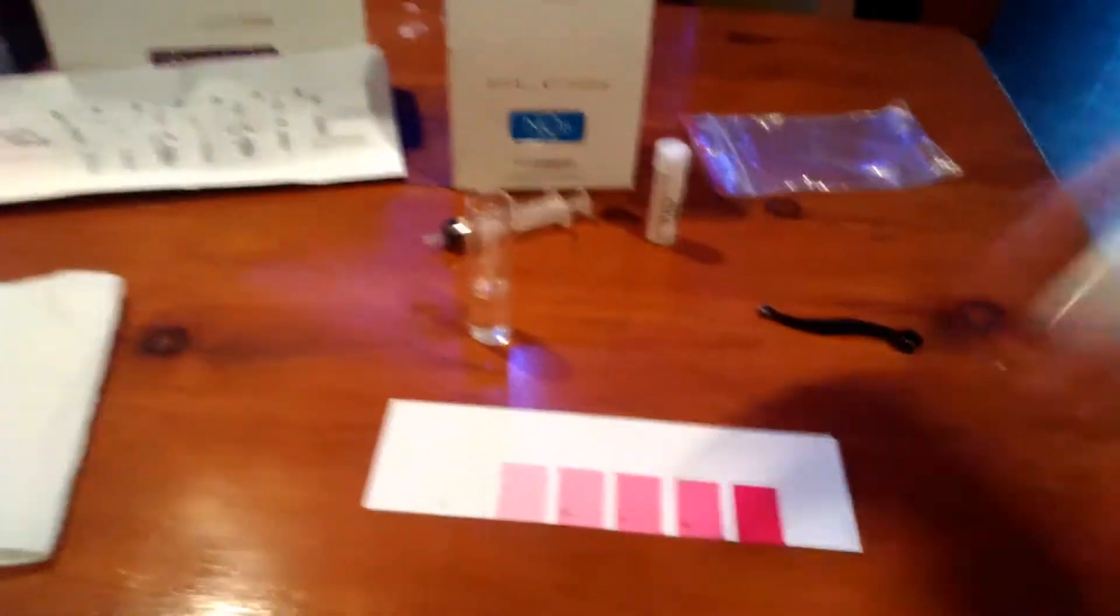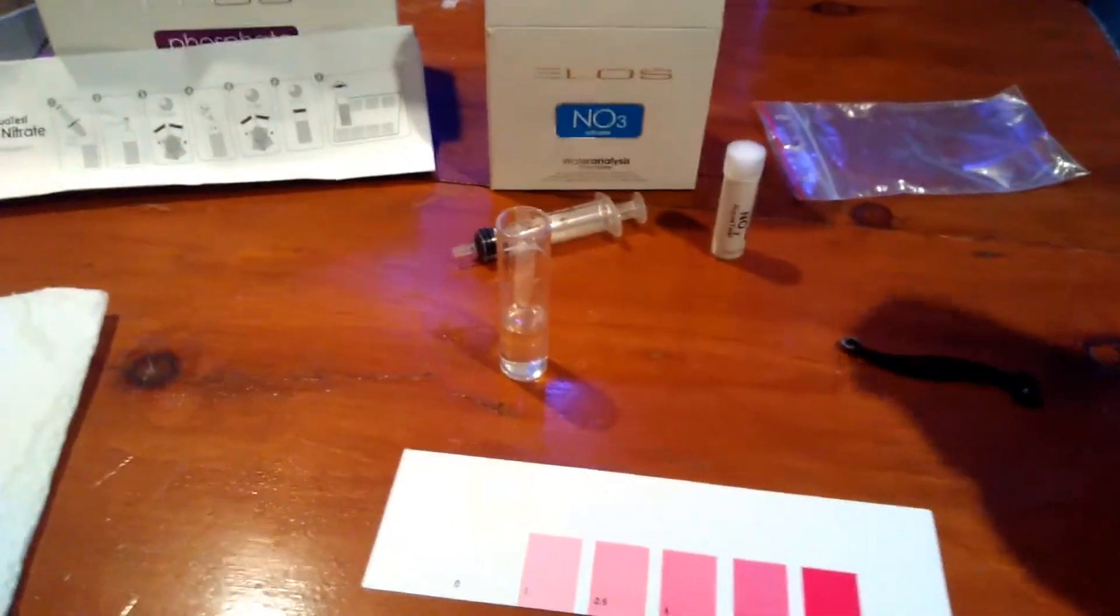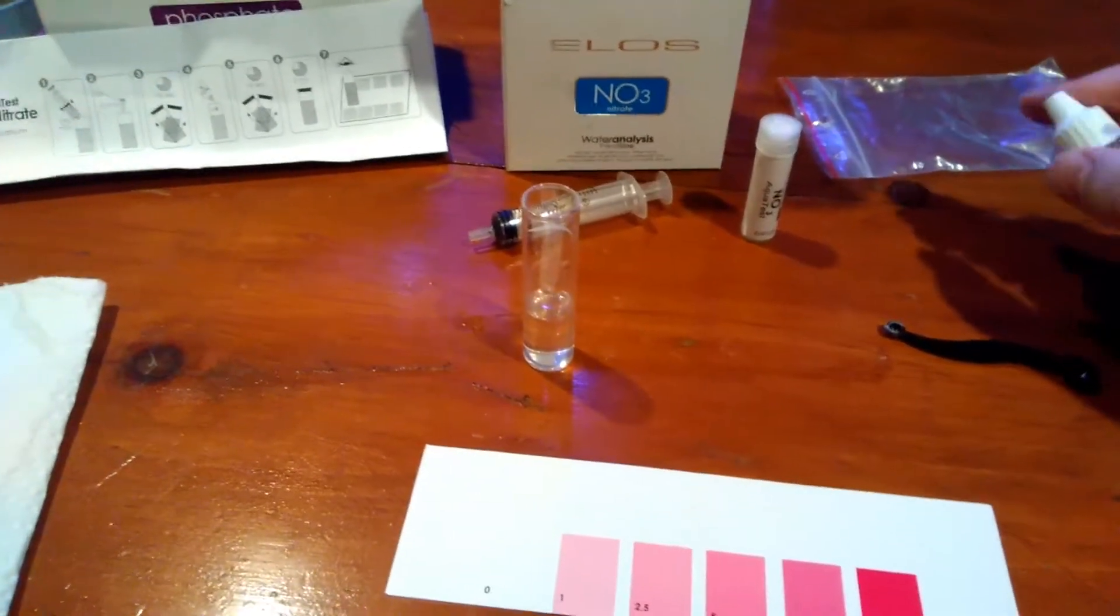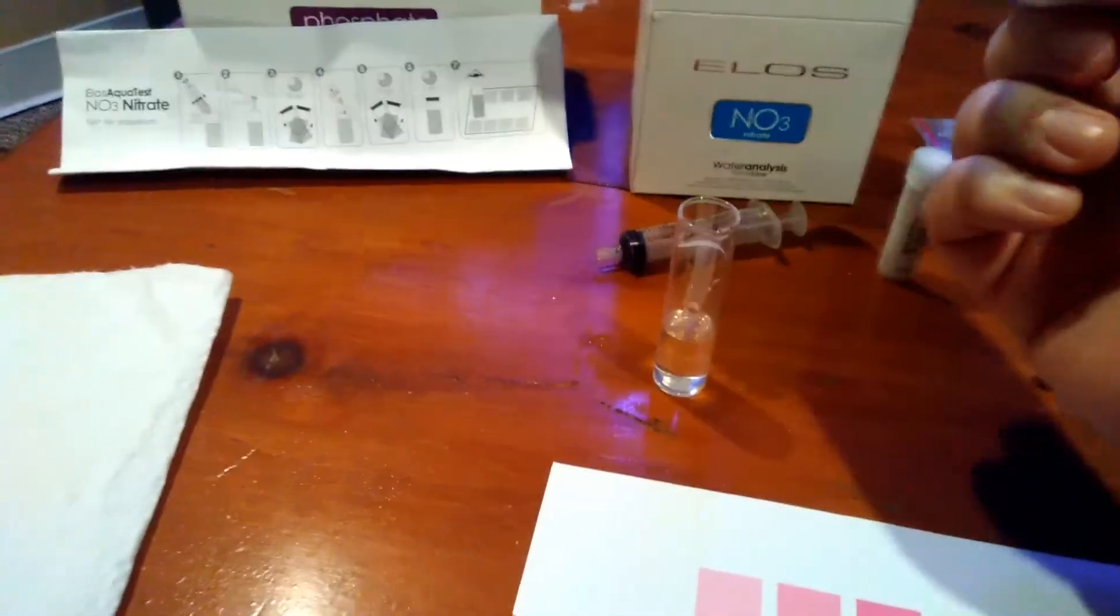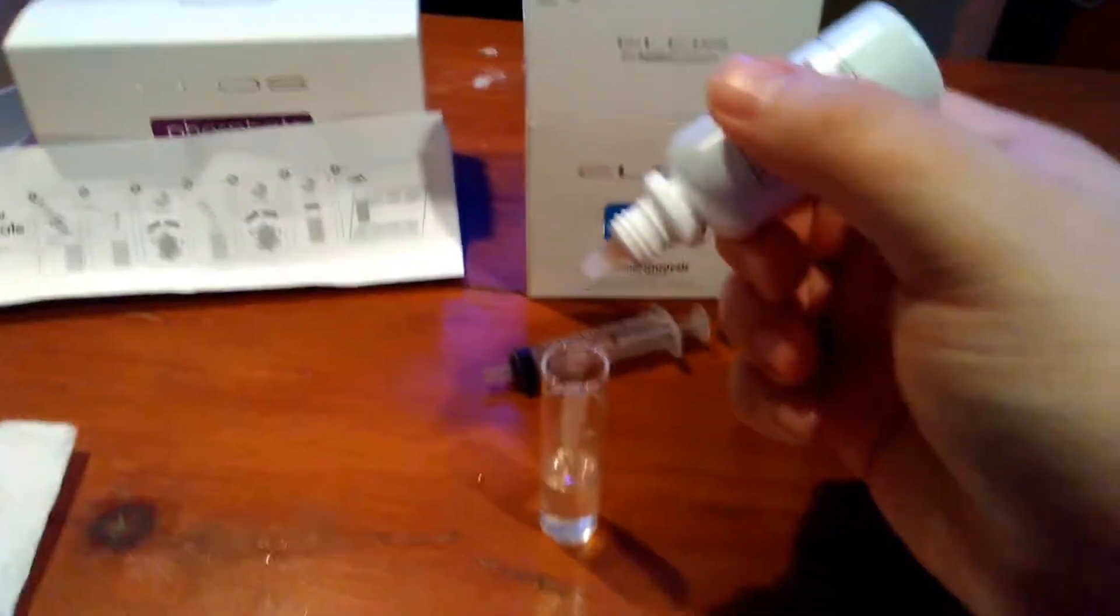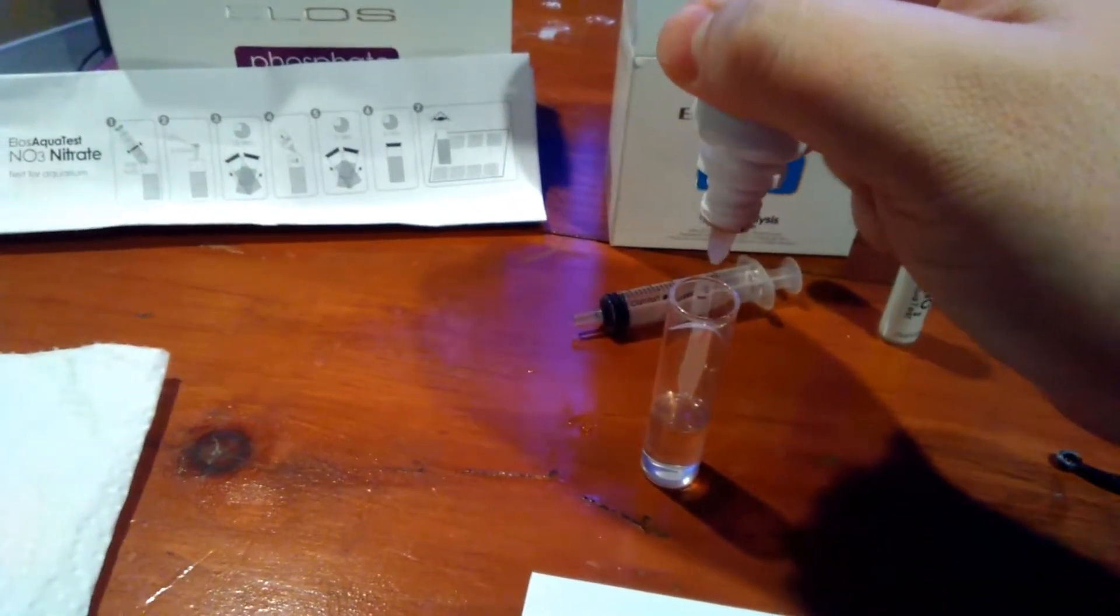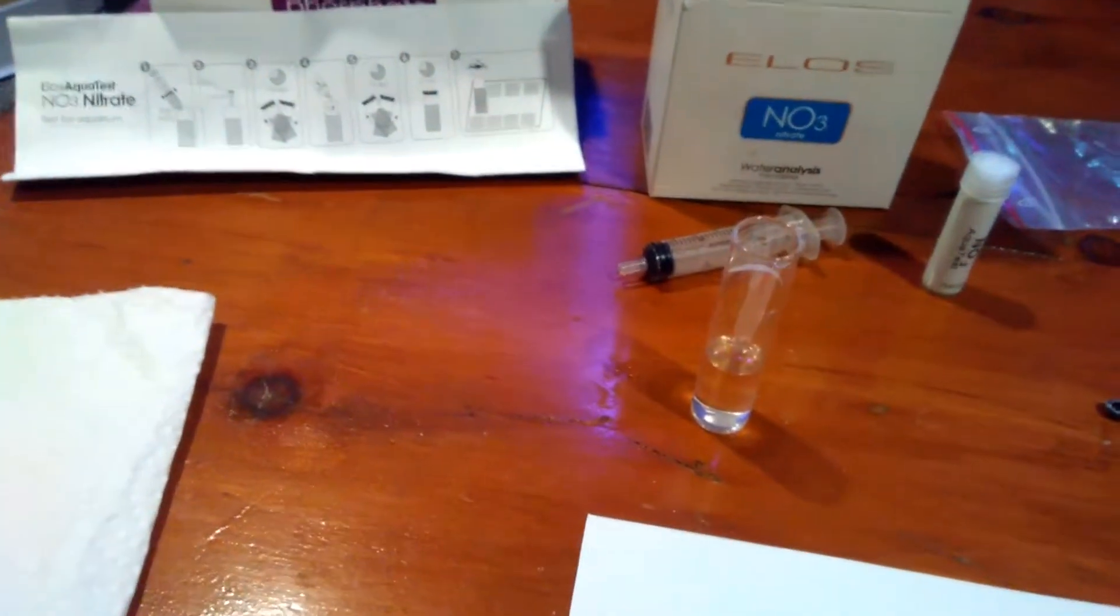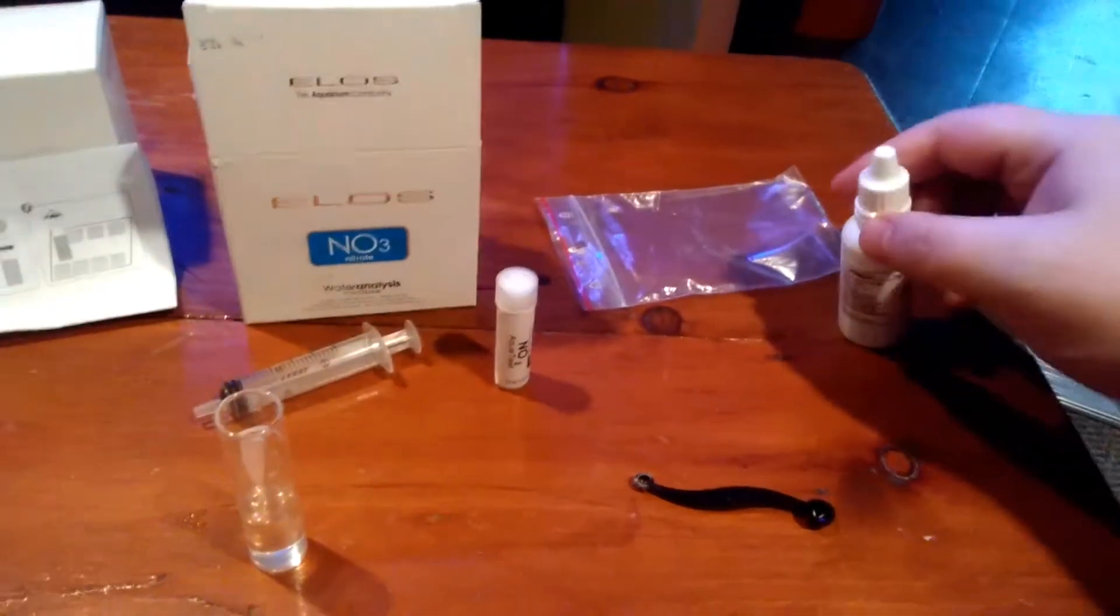I'm just going to re-shake it up a little bit. Sorry about the camera shaking, but I already had pre-shaken it before I started the video. There we go. 6 drops. Ready? 1, 2, 3, 4, 5, 6. Cap back on.